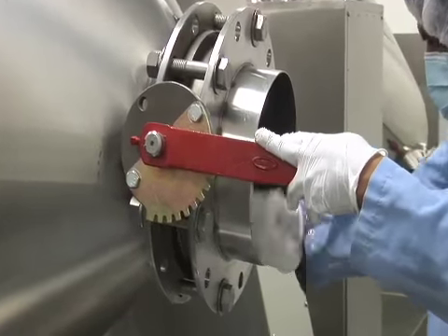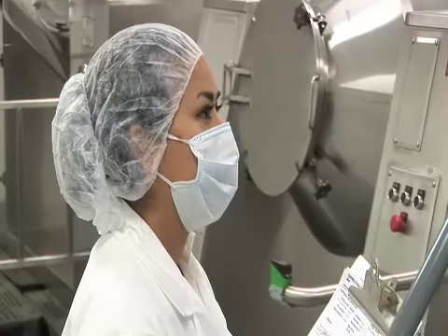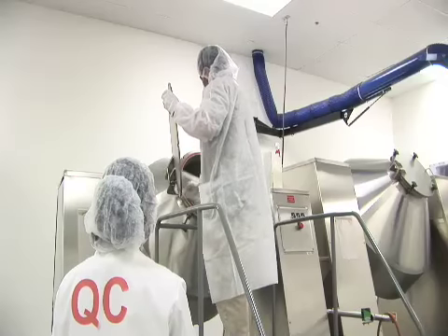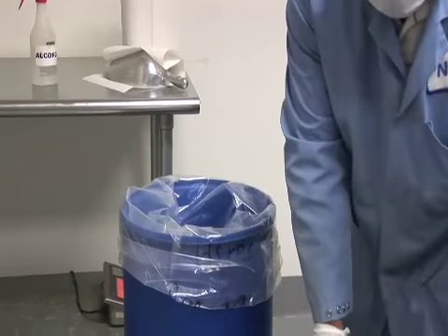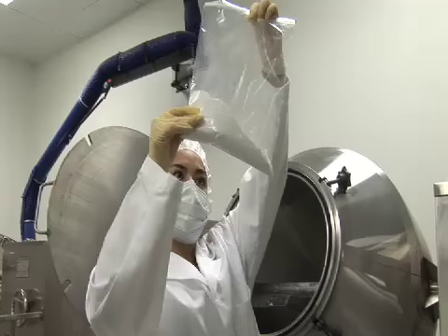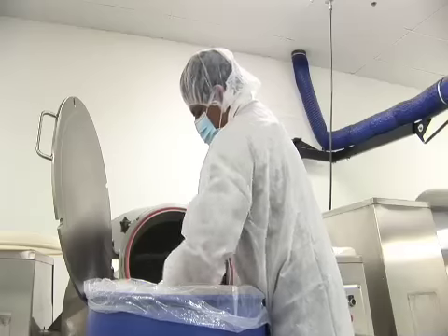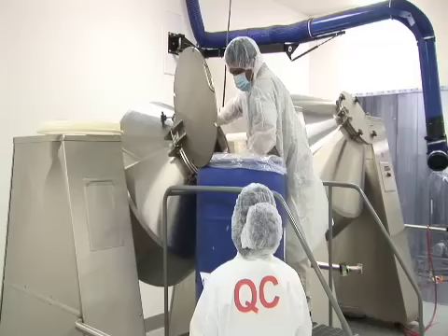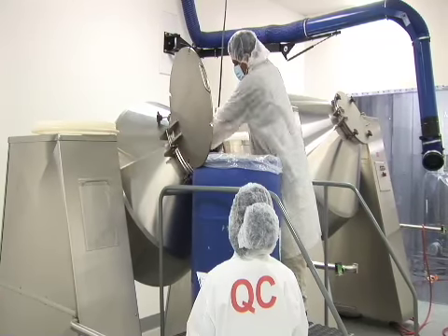Before they can be added to a mixer, a QC inspector examines the mixing area and its personnel. When a formula has several different ingredients, we make what is called a pharmaceutical mix. To make sure that a complicated finished blend is uniform, we carefully build it up from the smallest ingredient to the largest. The QC inspector oversees this process.